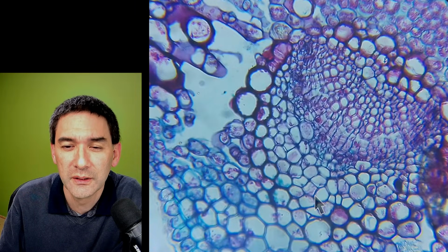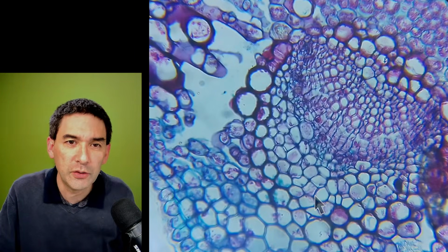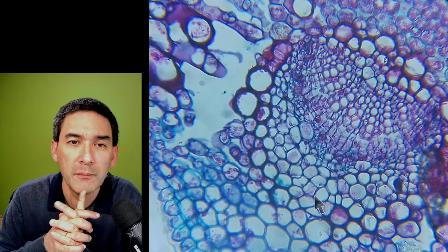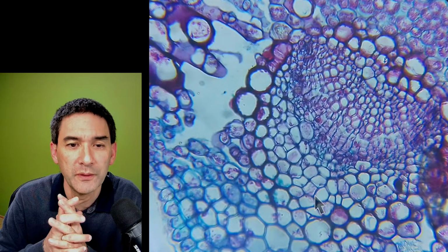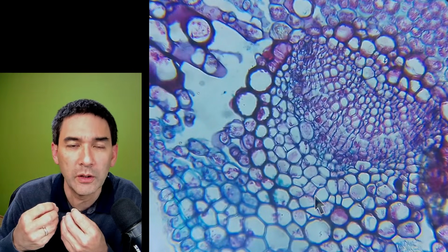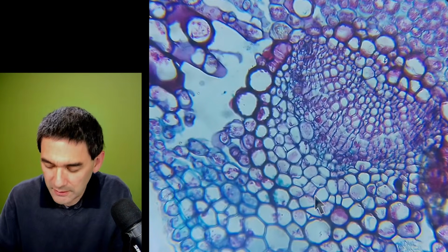Yeah. So I'm reading again here. I watched everything I could. So those darker, more red ones are more likely the xylem. Usually, honestly, I'd have to read a little bit into the plant anatomy and different plants. The arrangement looks different. Yeah. But generally, as a general rule of thumb, very often the larger vessels and larger diameter with a thicker wall are very often the xylem. Yeah. So let's have another look.